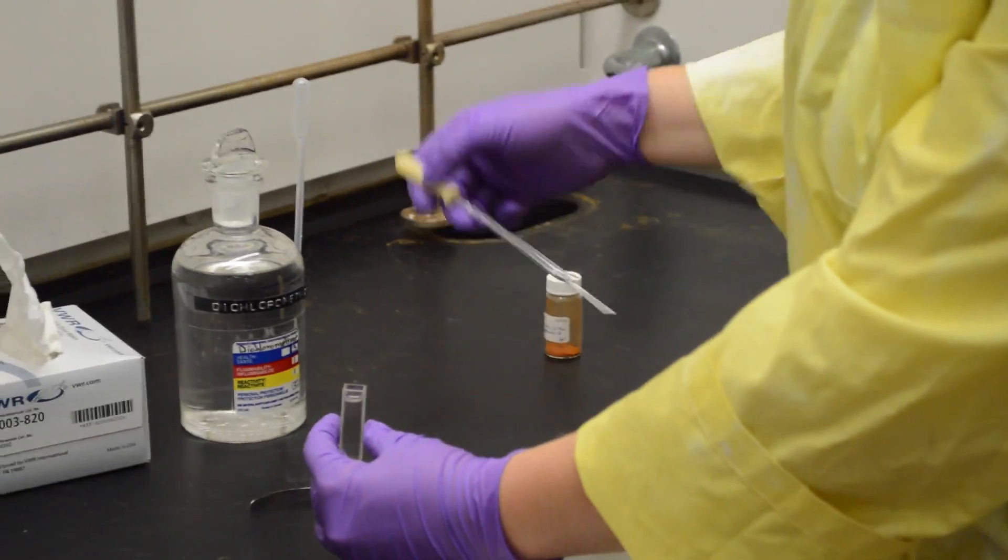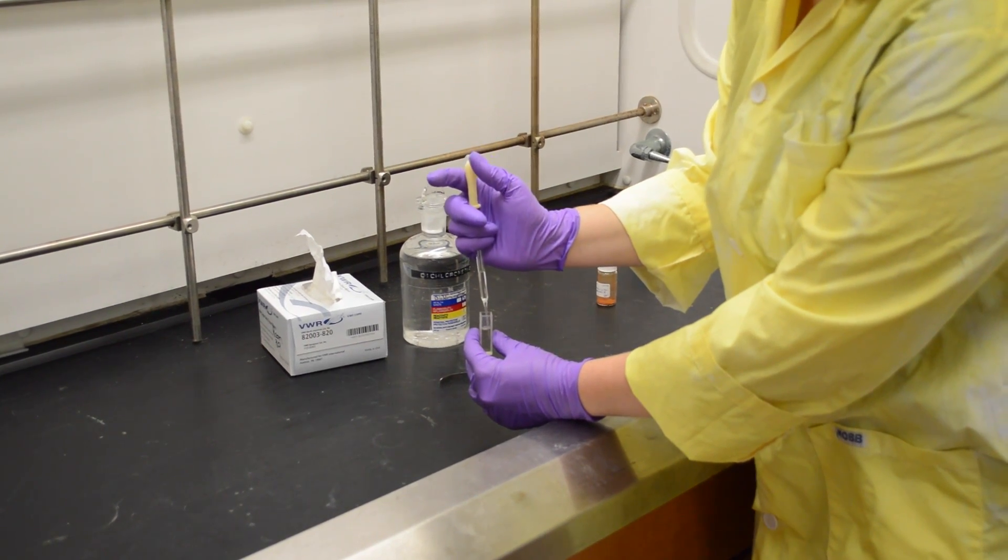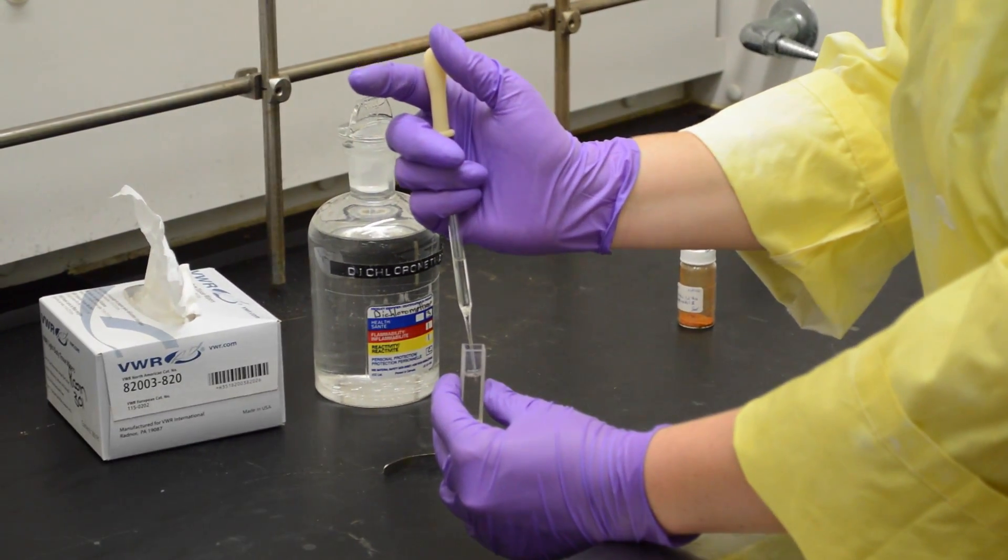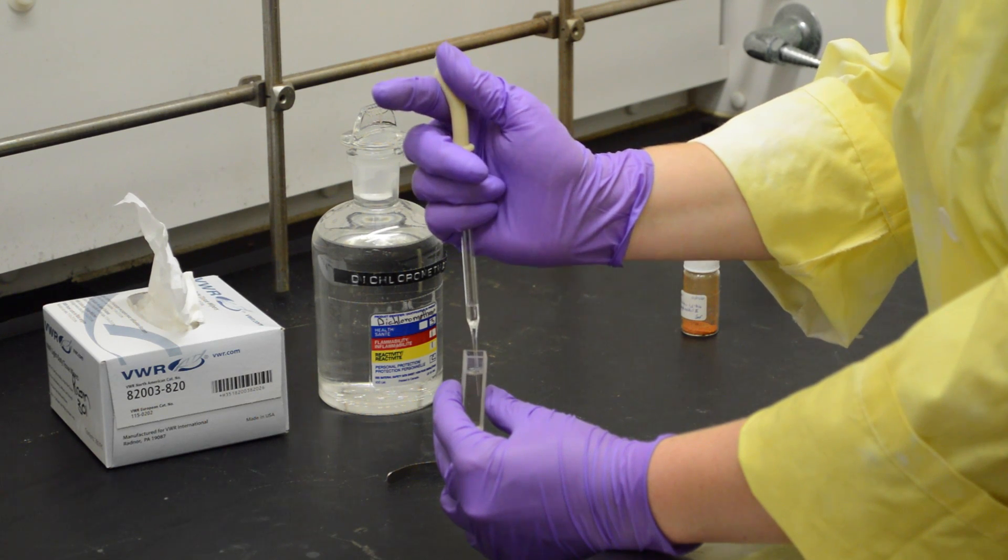Then I'm going to take a clean pipette and I'm going to mix the solution by drawing the solution into the pipette and putting it back into the cuvette.